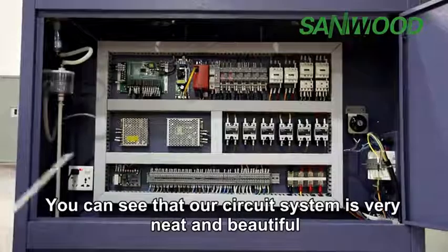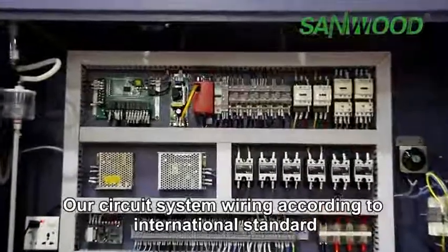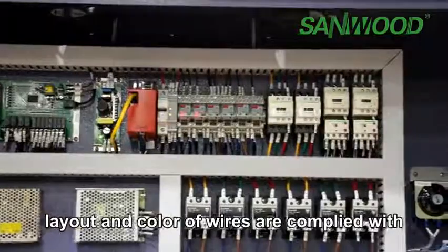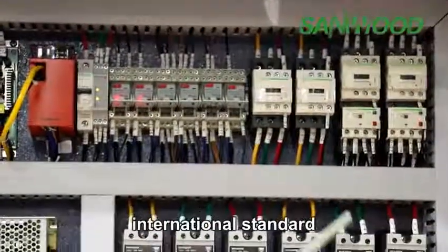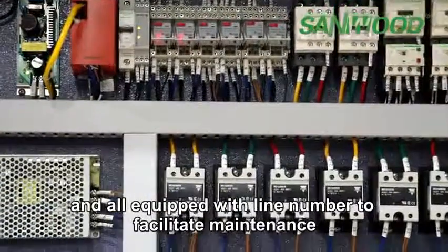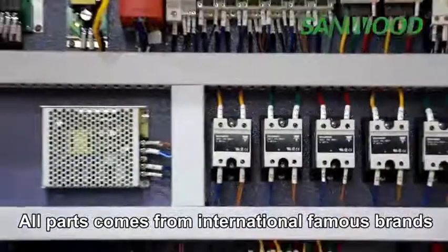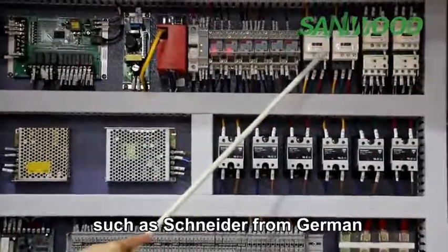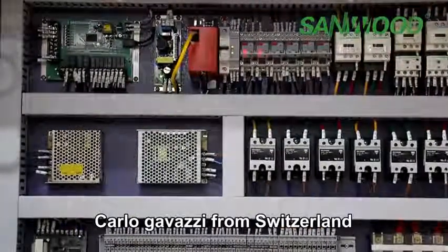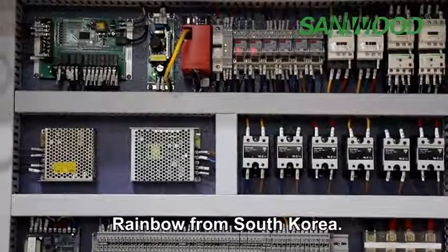You can see that our circuit system is very neat and beautiful. Our circuit system wiring follows international standards. The layout and the color of wires comply with international standards, and all are equipped with line numbers to facilitate maintenance. All parts come from internationally famous brands such as Schneider from Germany, Carlo Gavazzi from Switzerland, Mitsubishi from Japan, and Rainbow from South Korea.